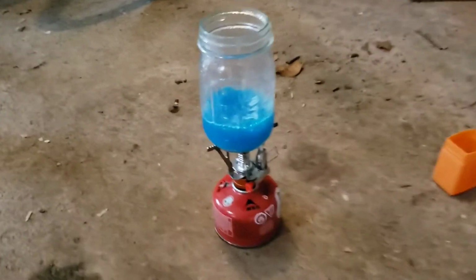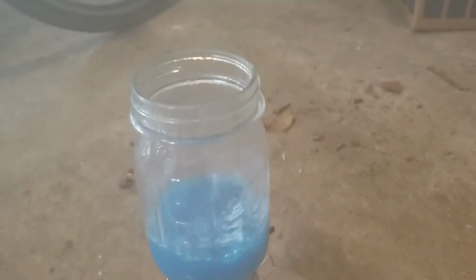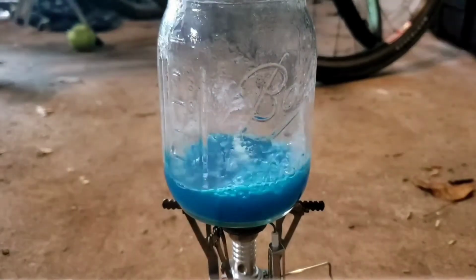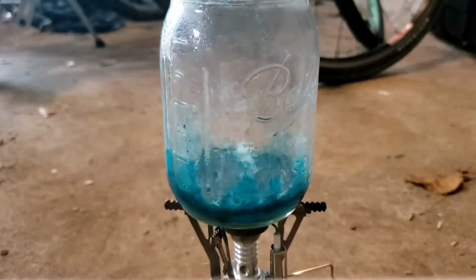So as you can see, I really didn't give much regard to the point at which glass would break, especially, you know, non-borosilicate glass like this, which is just normal glass. So of course, I just felt free to just turn the heat all the way up. And just as I thought it was coming to be completely dry as I turned the camera off, it broke, obviously.